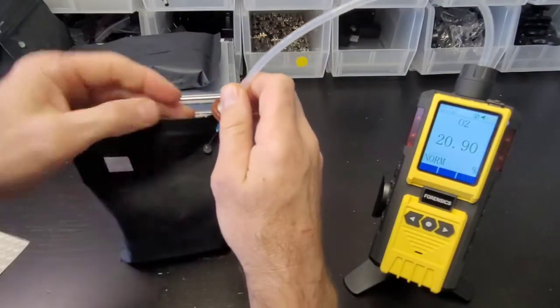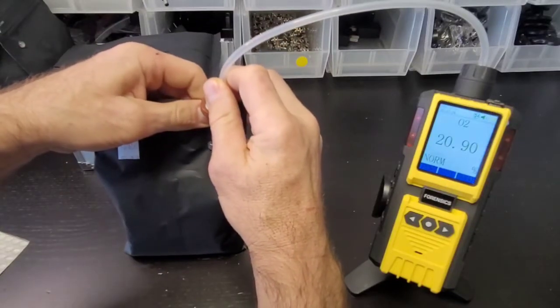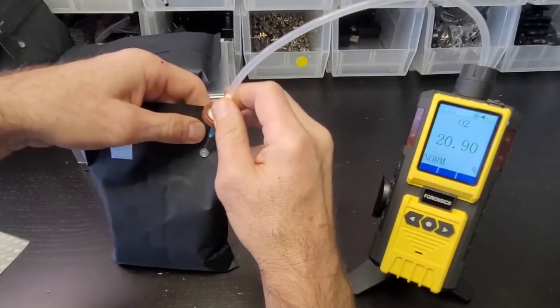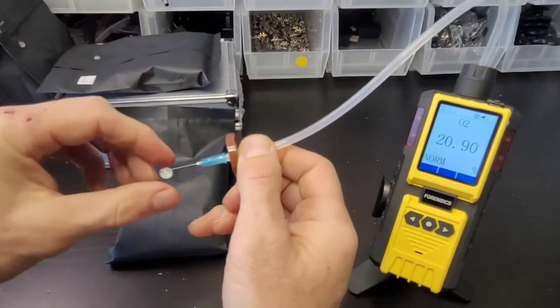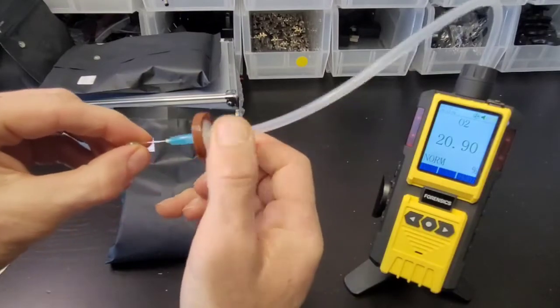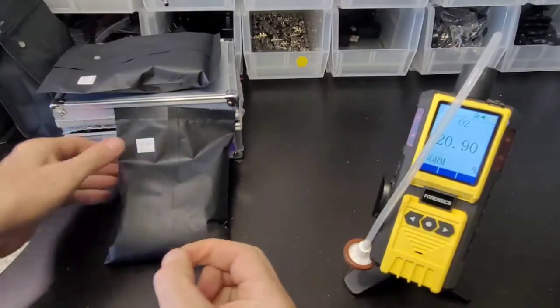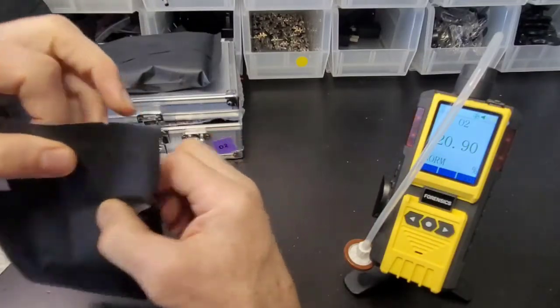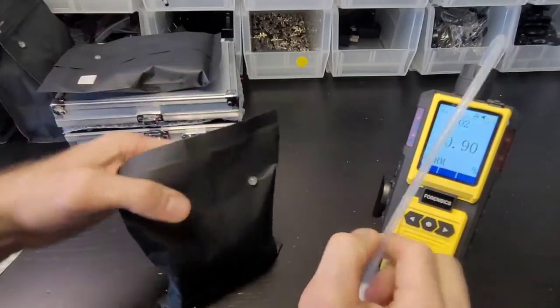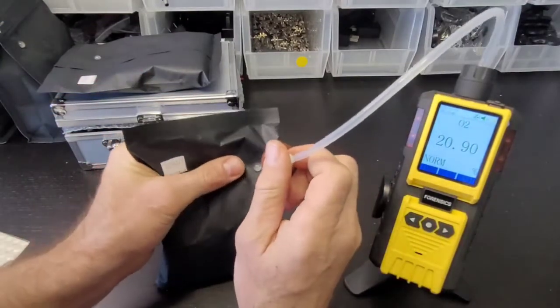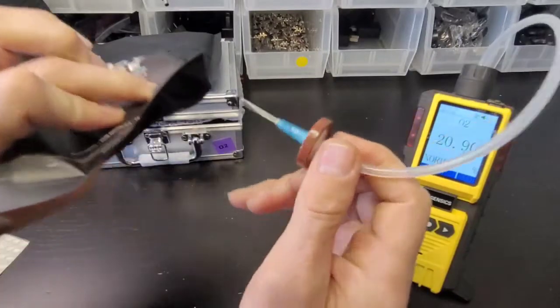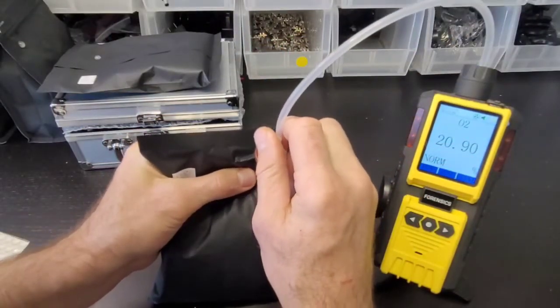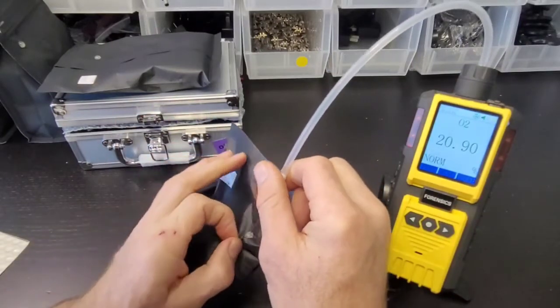Make sure there's not much headspace - you see there isn't much space here. I had it on an angle, created a bit of friction with too much force. Obviously the more headspace, the easier the analysis, but you don't want to go through the package, so you have to be fairly careful. Let's go very slow here.